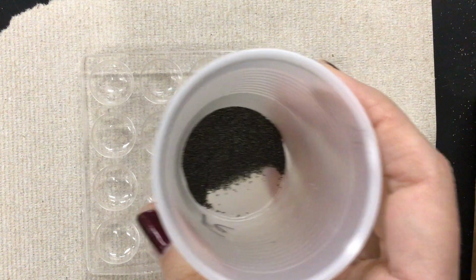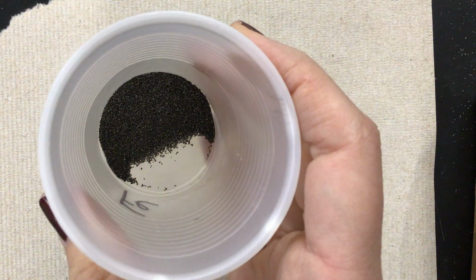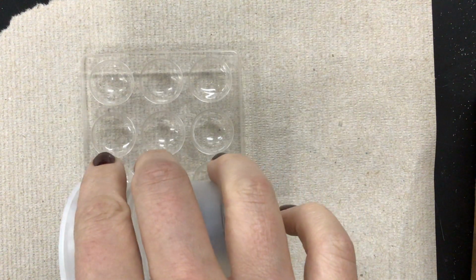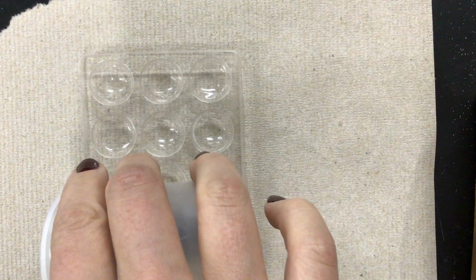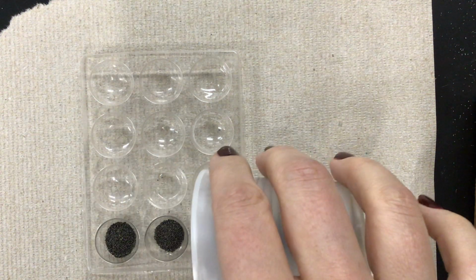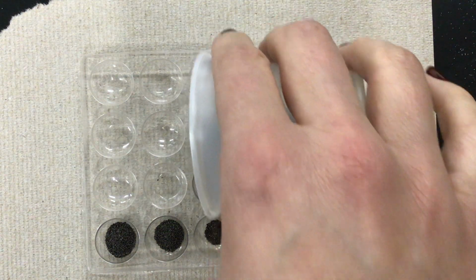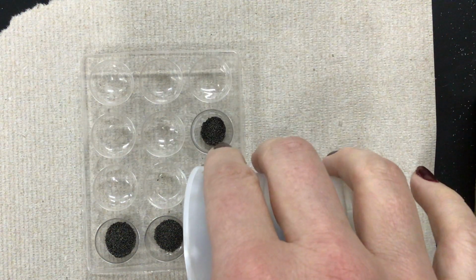I don't know if you have ever seen this before, but here's what iron filings look like. You might have seen these in a few toys growing up because you can actually manipulate these with a magnet. So iron is actually magnetic. You might have seen these in some of your toys that have magnets in them.